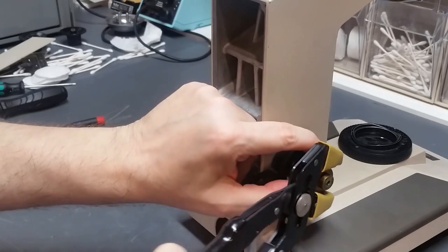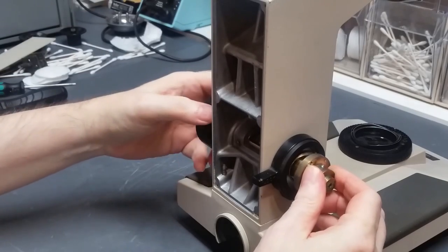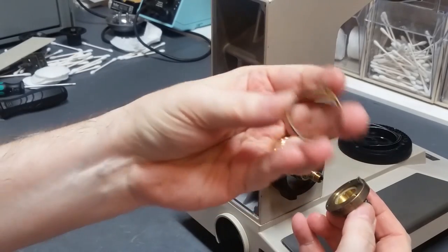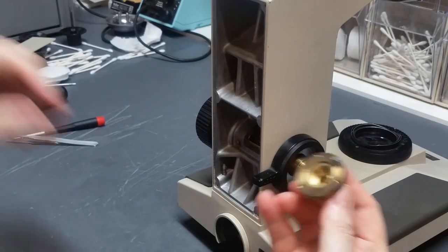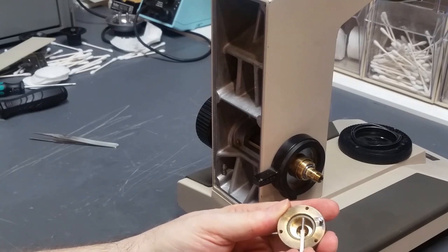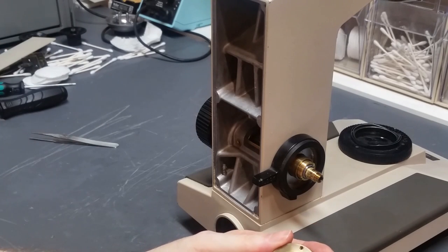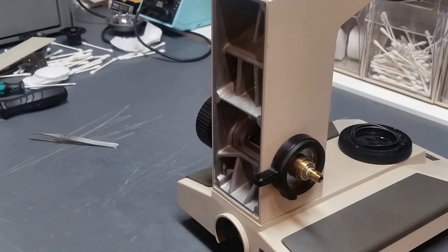And I believe we're there. And there's a coil spring underneath that, so you want to make sure you don't damage that spring when you pull it apart. So here's your coil spring. Here's the brass piece. And if you notice, there's another nylon thrust washer inside there. We'll take that out, bring that up. And that's it for this step.